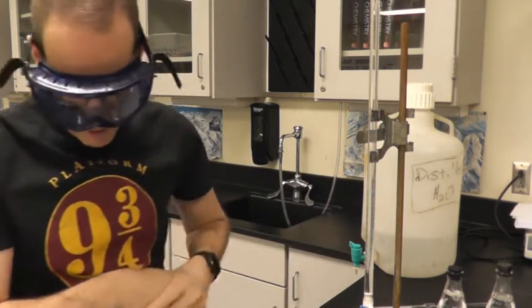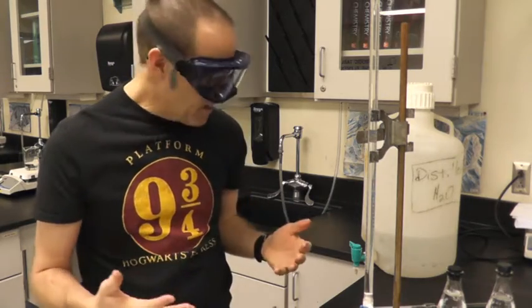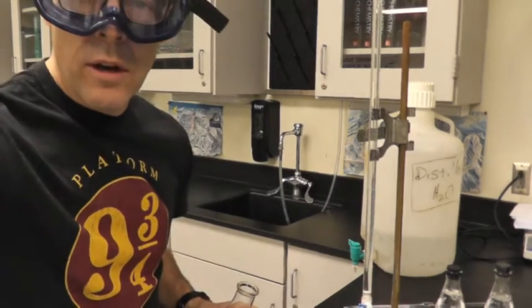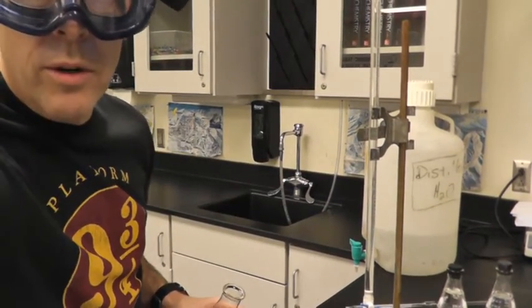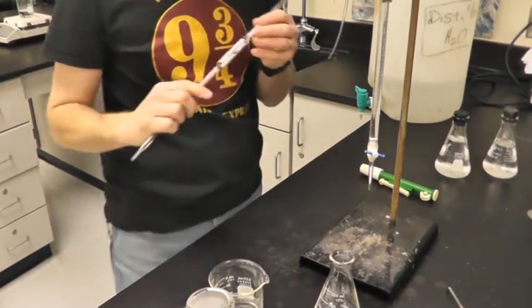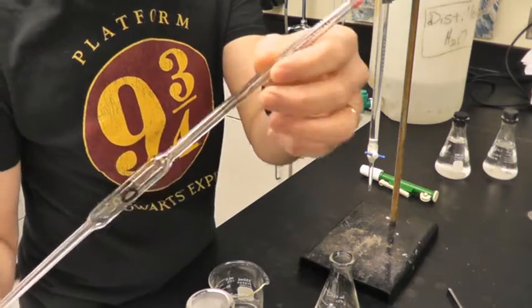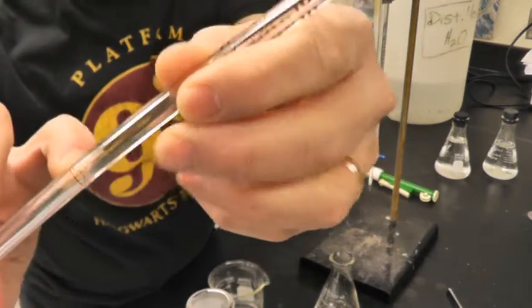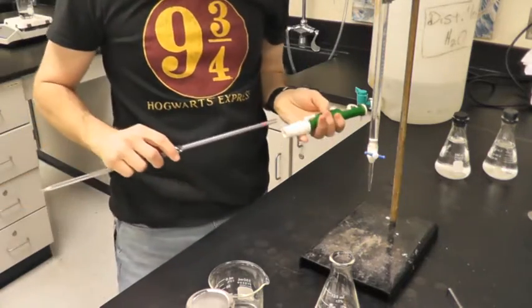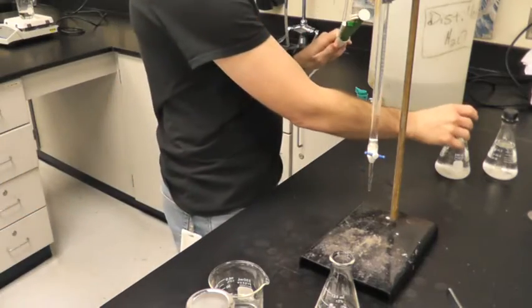The next thing we're going to do is, if you look at the very bottom, I'm going to start adding stuff to a flask. All right, so this is one of those things where I wish you were here to use this piece of equipment. So this is called a volumetric pipettor. Okay, so kind of like a volumetric flask, that line right there is exactly 10 milliliters. Okay, so we use this guy that's going to help get our calcium iodate.